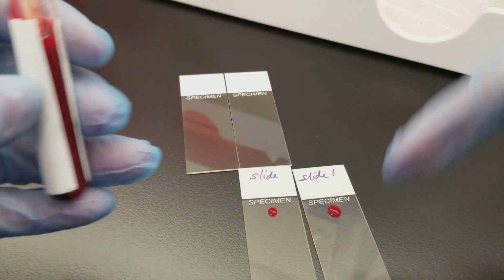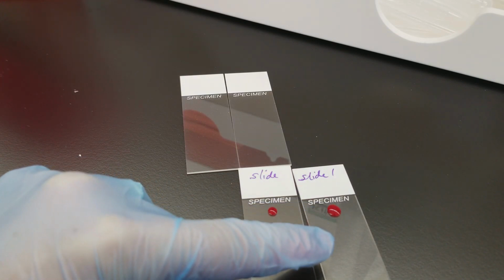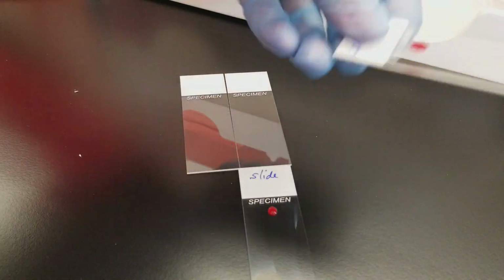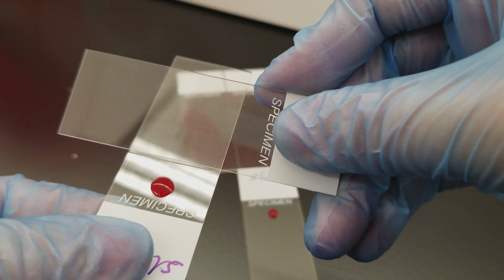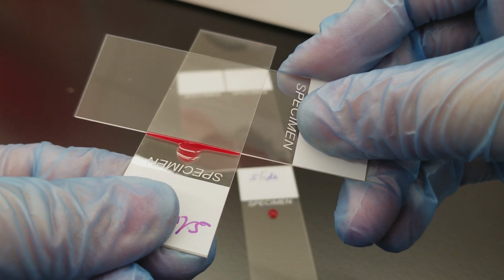I did this on purpose, or at least I'm going to say I did. This drop is way too big, and this one is just about right. When we try to spread one that's too big, you're going to get a really, really thick film, which is not going to work out too well. So what I'm going to do is use the side of the spreader slide. You put it in contact with the lower slide, pull back, let it spread, and then go across. Okay, so you get a thin film.